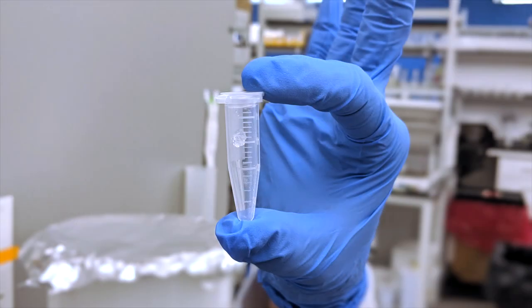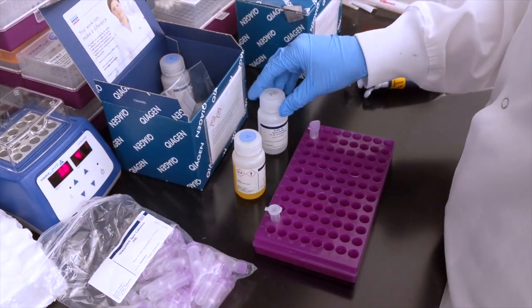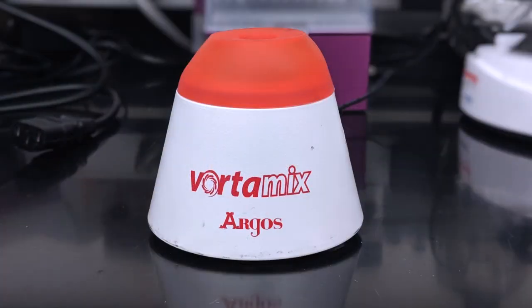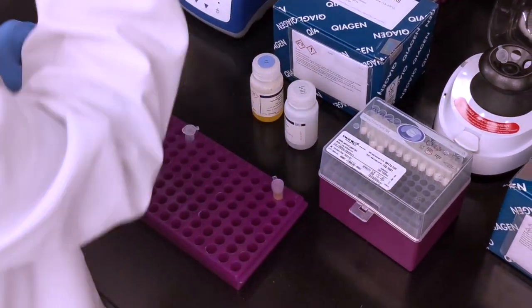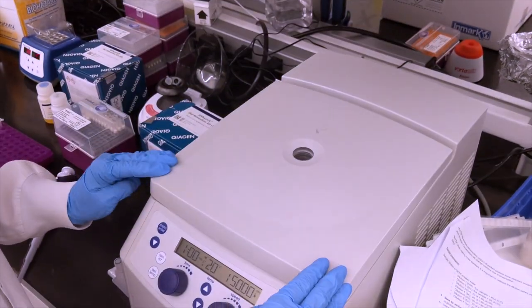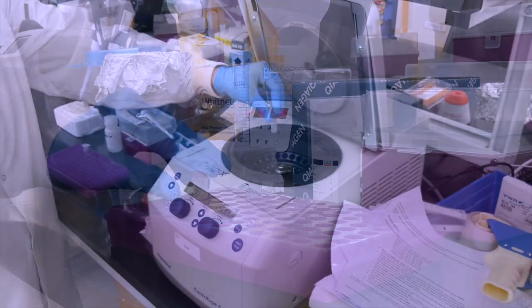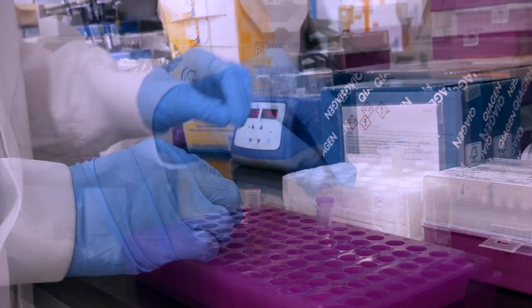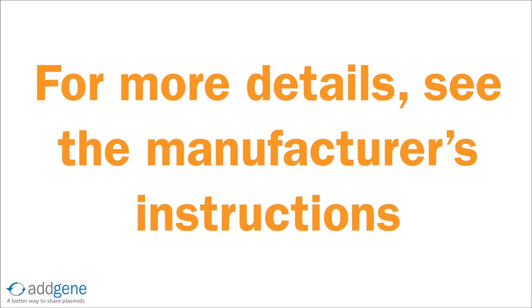Now we are ready to purify the DNA from the remaining agarose gel matrix. For this process, we use commercially available purification kits. These kits work by first breaking down the gel with heat and mild vortexing to release the DNA fragments, binding the DNA to a centrifugal filter, purifying the DNA through several wash steps, and finally eluting the DNA from the column. Always follow the manufacturer's instructions.